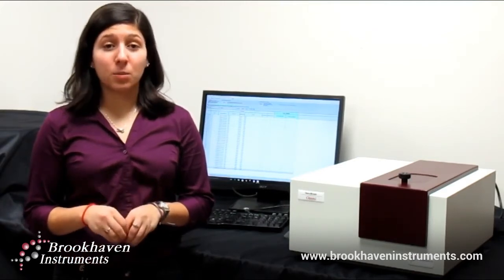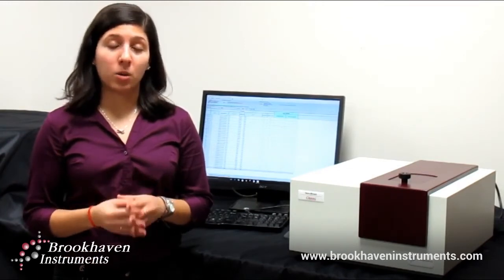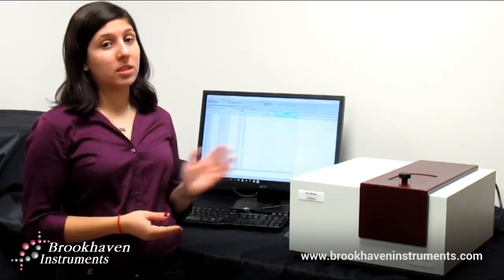In this video, I will discuss a standard method to ensure clean samples as well as demonstrate how our software suite Particle Solutions can aid with measuring imperfect samples.